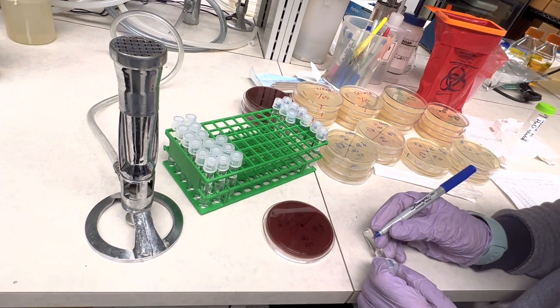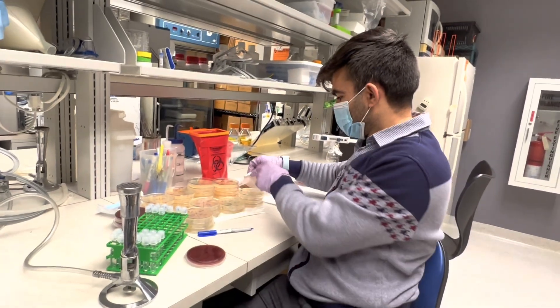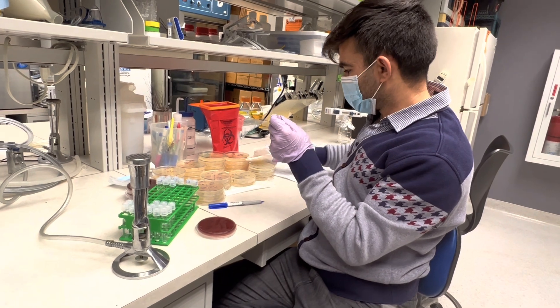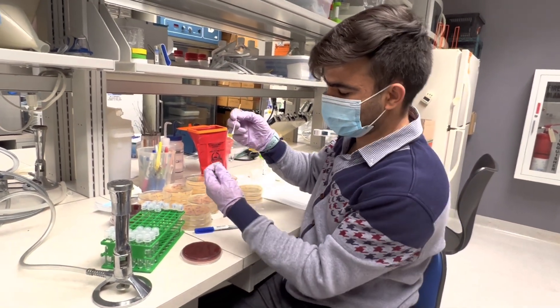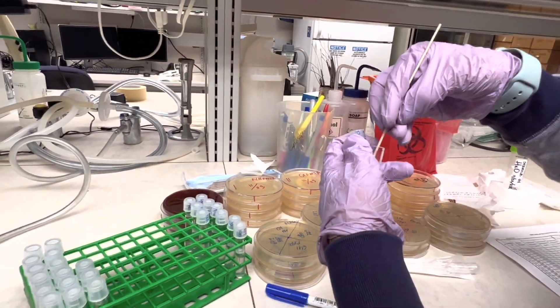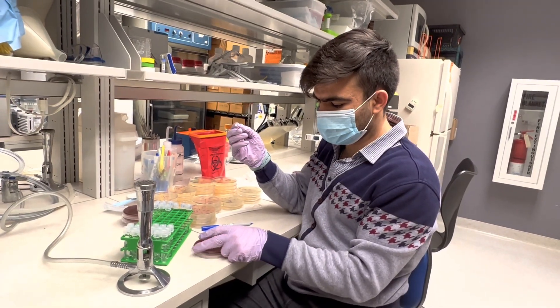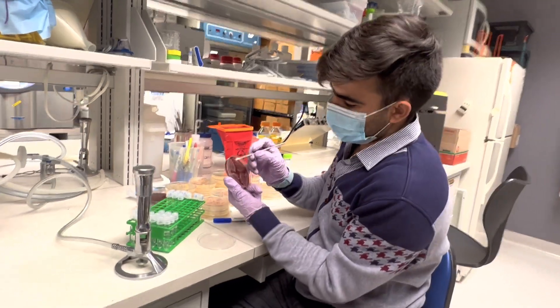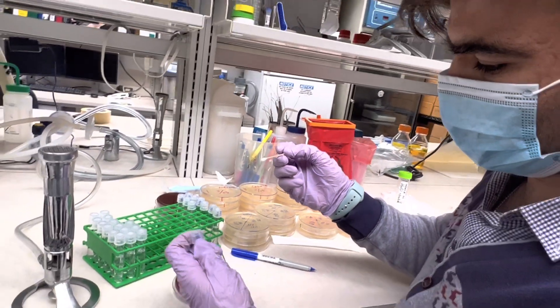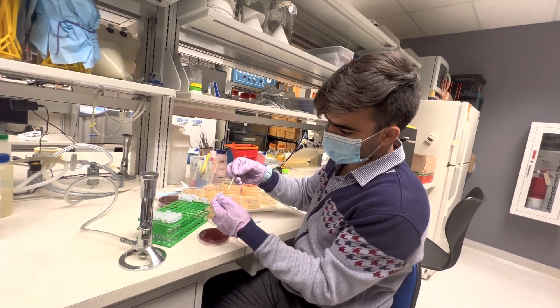I label this as 600-42 FEP. Then I take swabs — these are sterile. I take a swab and wet the cotton tip with water to make picking the isolates or colonies easier. Then I take a few colonies and inoculate them into the distilled water inside the tube.